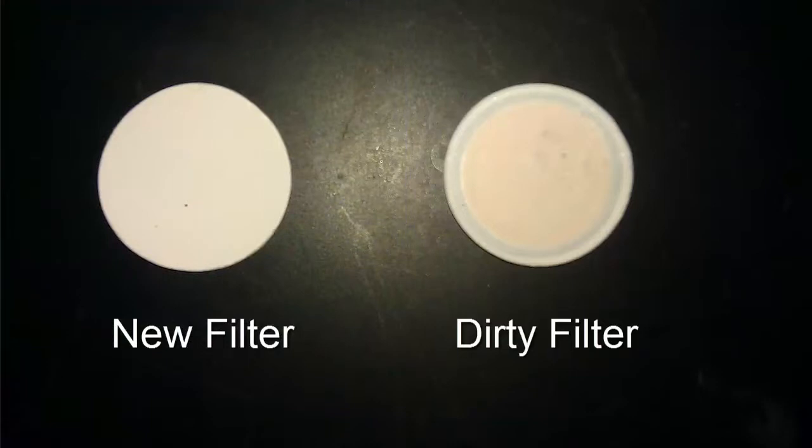The dirty filter will generally appear discolored and may even have a layer of solid material collected on it. Next, the new filter should be clean and smooth.